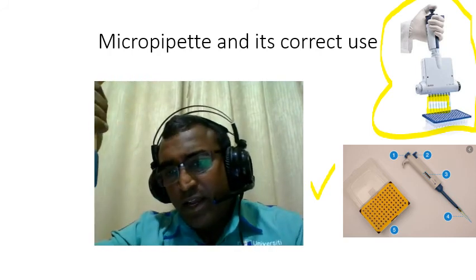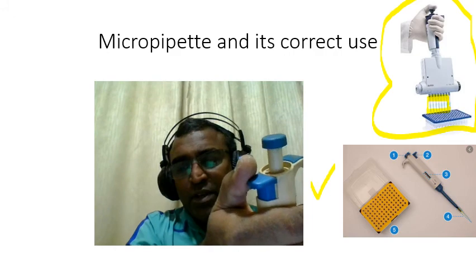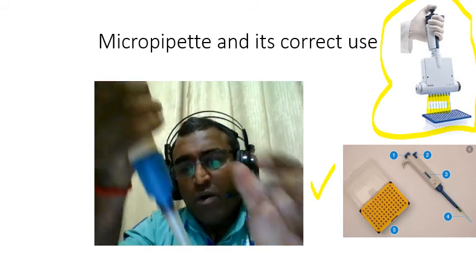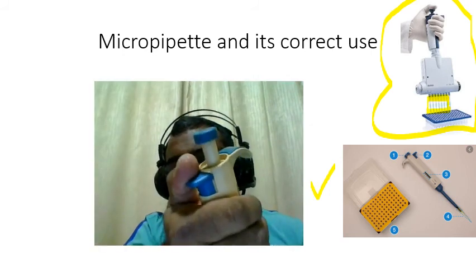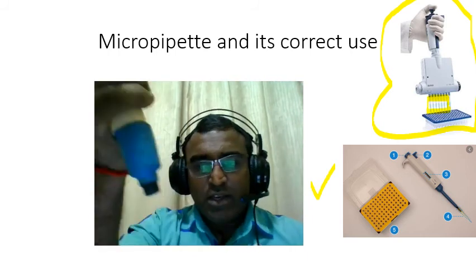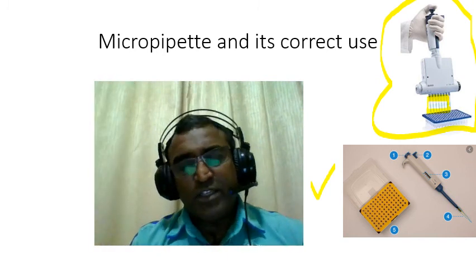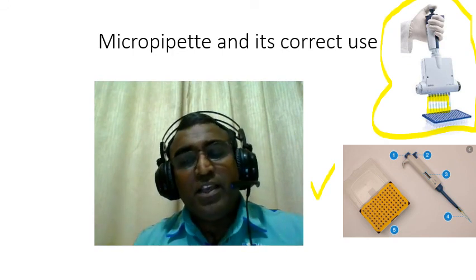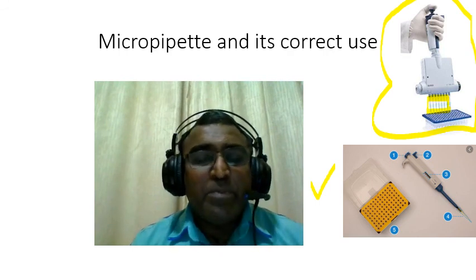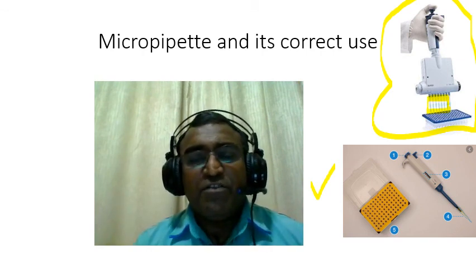So you have number 2 in the photograph there, which is this one. In order to take out the tip, you can take it out with your hand, or you can press this number 2 hard enough. Then you will see the tip comes out. So that's how simple it is to use a micropipette in the correct manner. I hope you are well aware and remember it. And when you go to the industry, it is a matter of refreshing your memory.